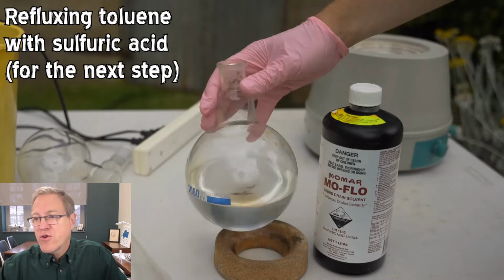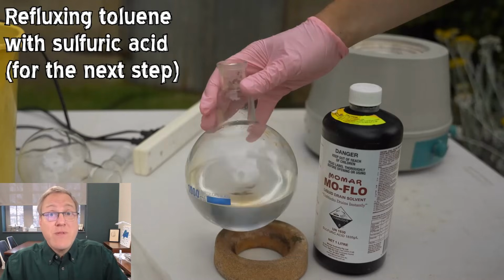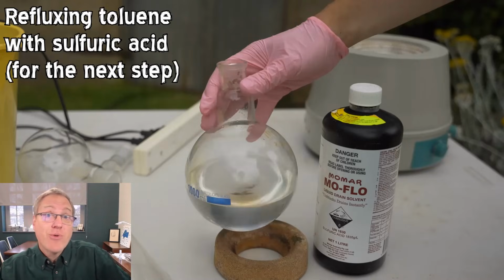There's a bottle of sulfuric acid, and he's just using drain cleaner. And this is why sometimes people say, don't use drain cleaner on your house with its metal pipes, its copper pipes, because the drain cleaner will do a number on your pipes. So anyway, this is the source of sulfuric acid, and he's using this.